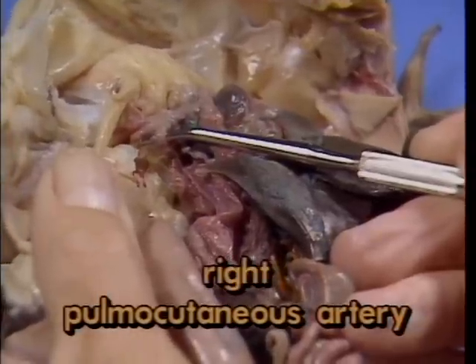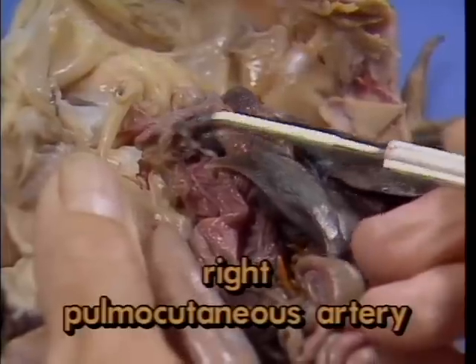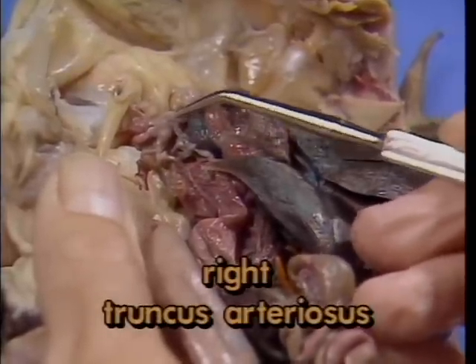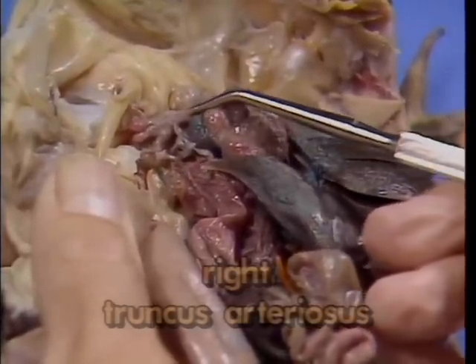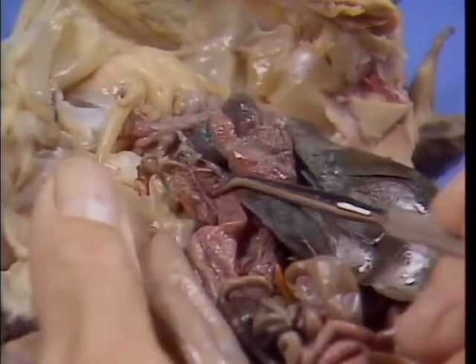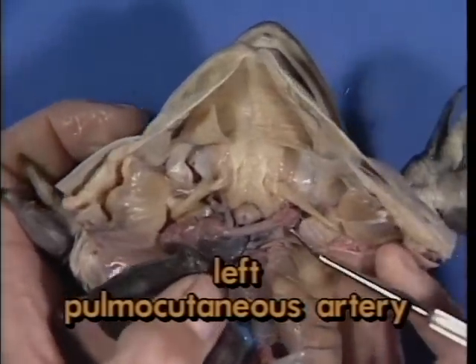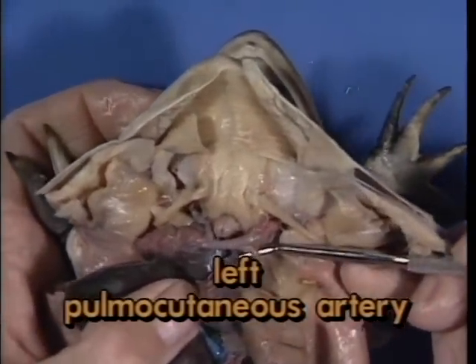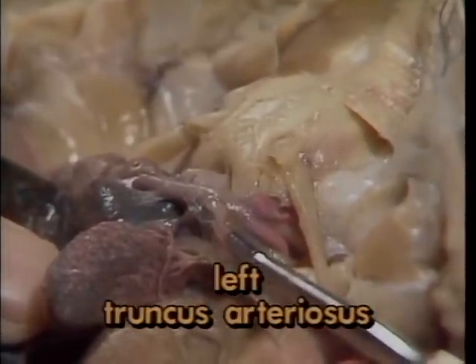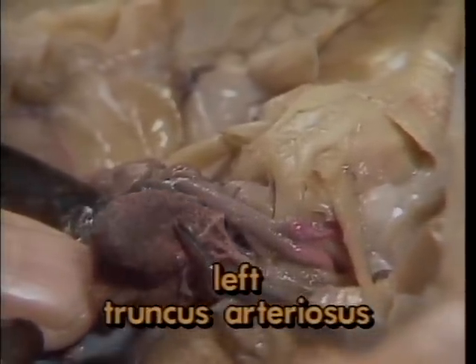The right pulmocutaneous artery is one of 3 vessels which lies within the wall of the right truncus arteriosus and carries blood to the right lung. The left pulmocutaneous artery lies inside the left truncus arteriosus and delivers blood to the left lung.